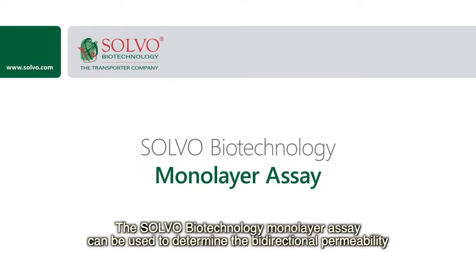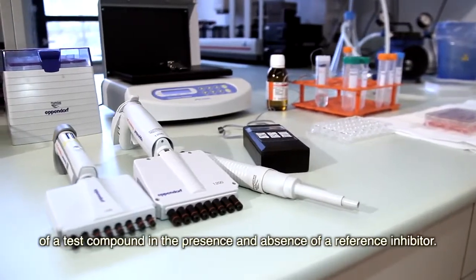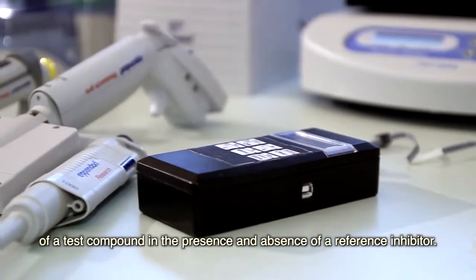The Solvo Biotechnology Monolayer assay can be used to determine the bidirectional permeability of a test compound in the presence and absence of a reference inhibitor.